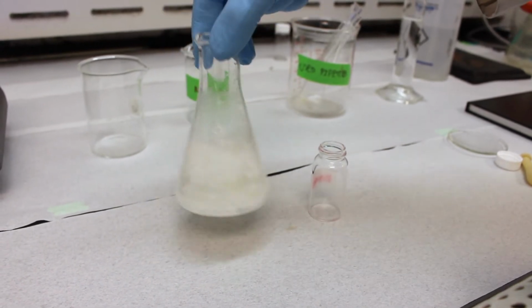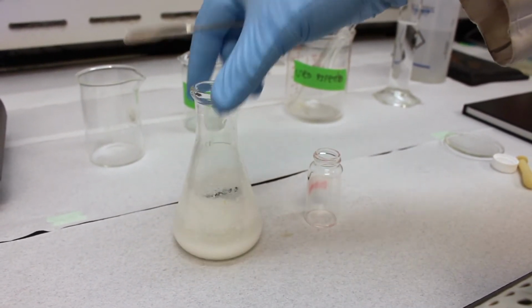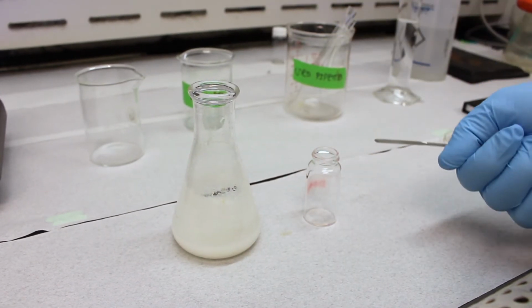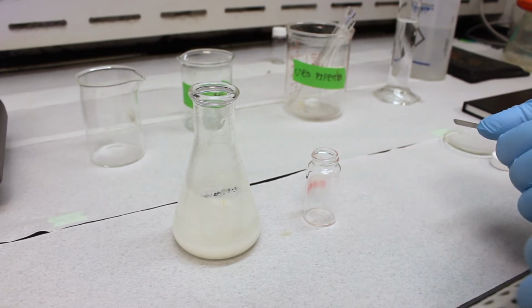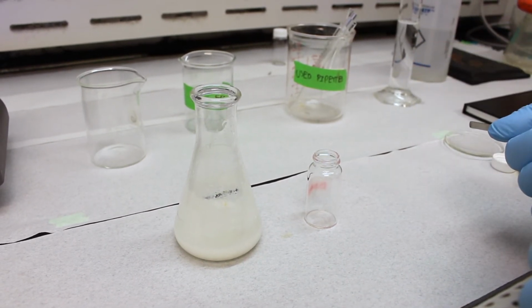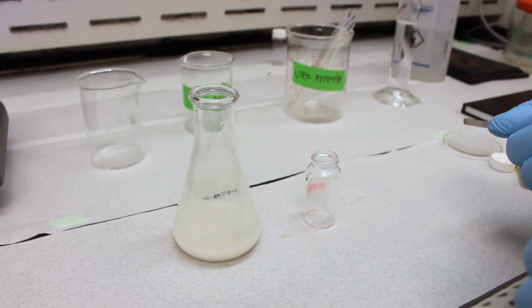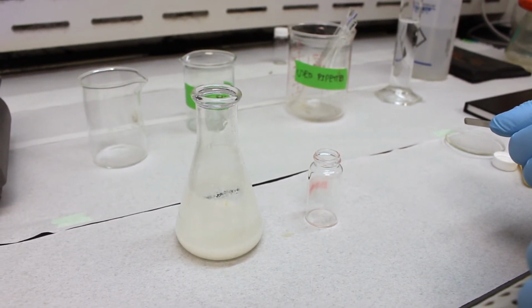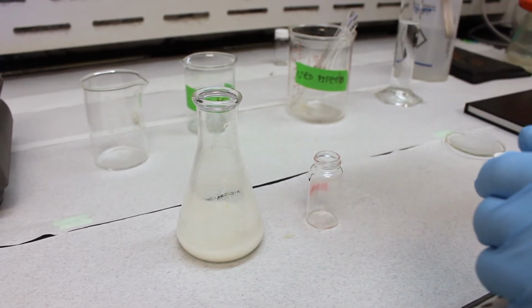So the next step is the recrystallization, and this is really the main emphasis of this week's experiment. So in last week's experiment, we did a separation of organic liquids by their boiling point, so using distillation. This week we're going to use a similar physical separation method that separates not based on boiling point, but instead based on solubility. And that's going to deal with recrystallization.